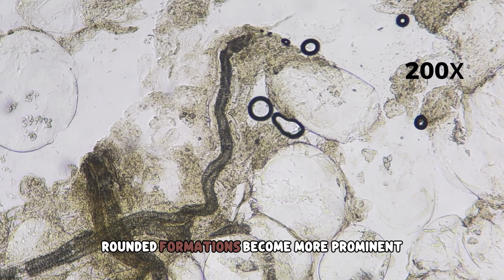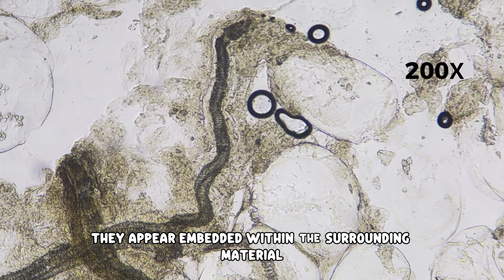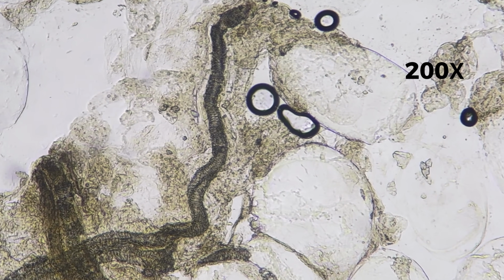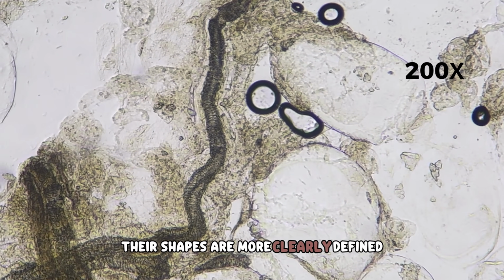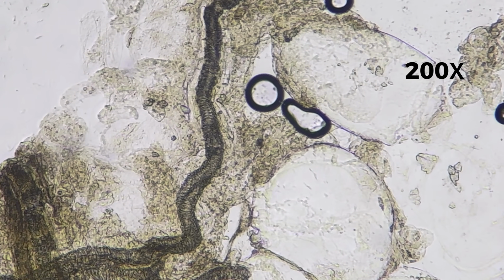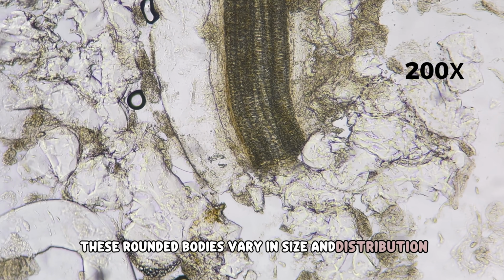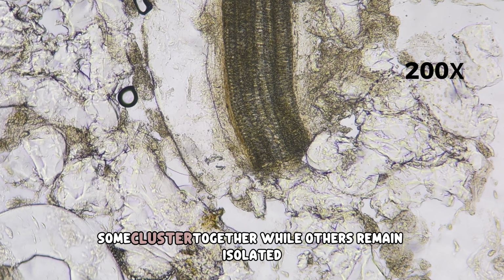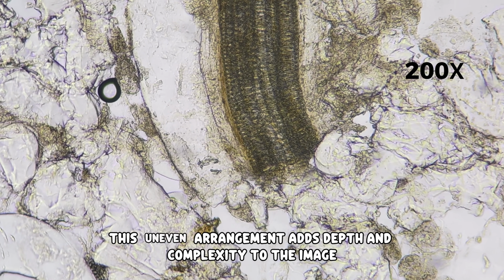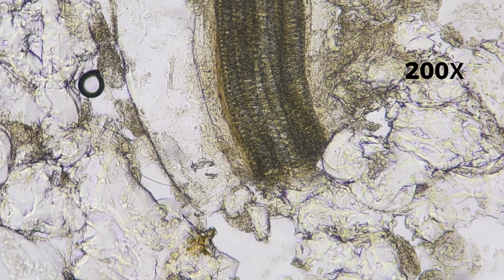Rounded formations become more prominent at this scale. They appear embedded within the surrounding material rather than floating freely. Their shapes are more clearly defined, and their boundaries stand out against the background. These rounded bodies vary in size and distribution. Some cluster together while others remain isolated. This uneven arrangement adds depth and complexity to the image.